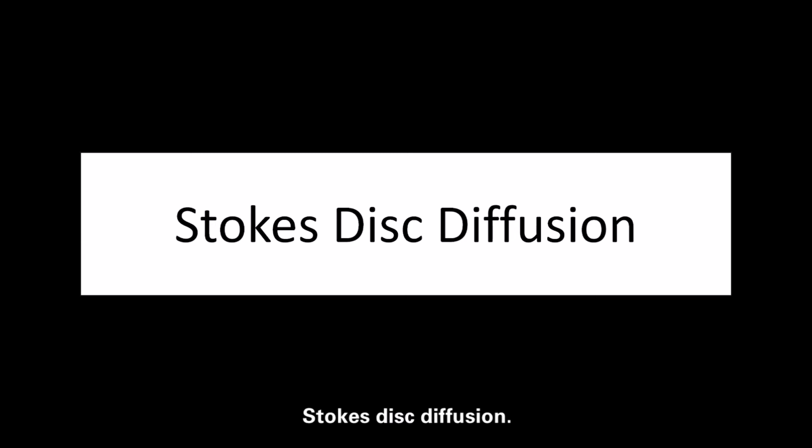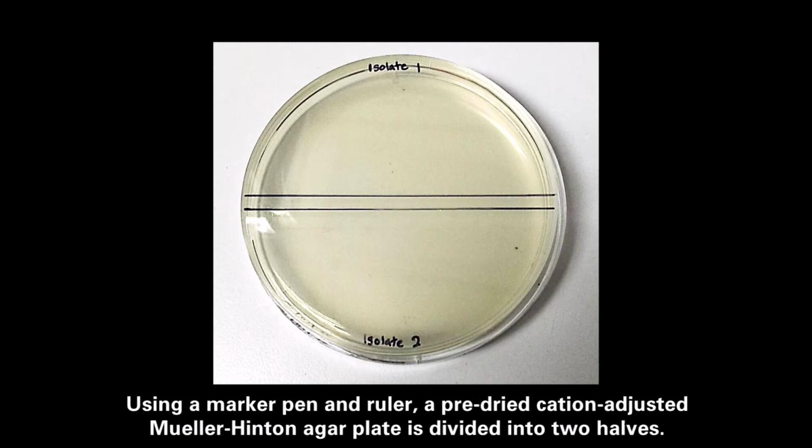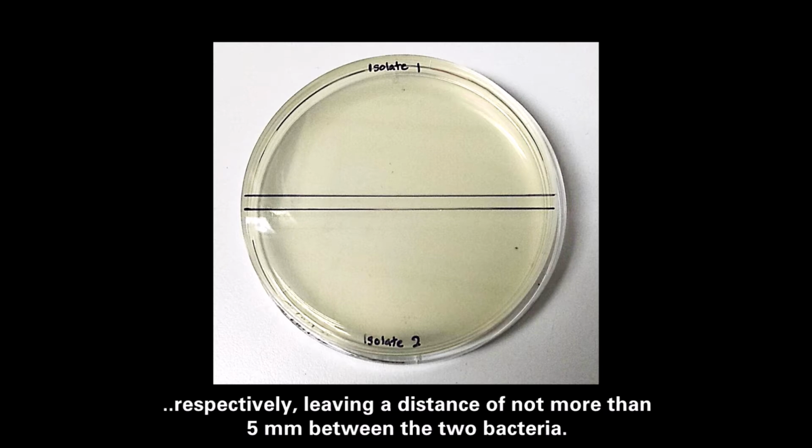Stokes disc diffusion. Perform the Stokes disc diffusion using the following procedure. Using a marker pen and ruler, a pre-dried cation adjusted Mueller-Hinton agar plate is divided into two halves. The two inocula are to be streaked evenly across each half of the plate respectively, leaving a distance of not more than 5 mm between the two bacteria.